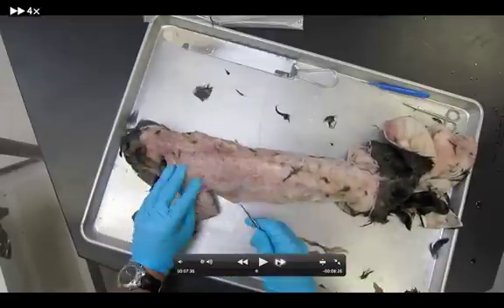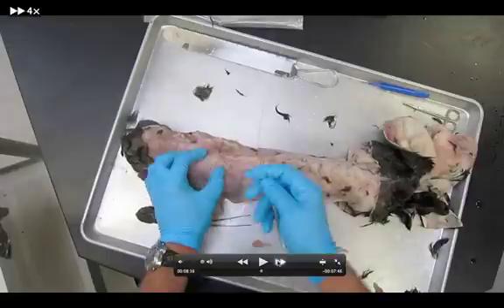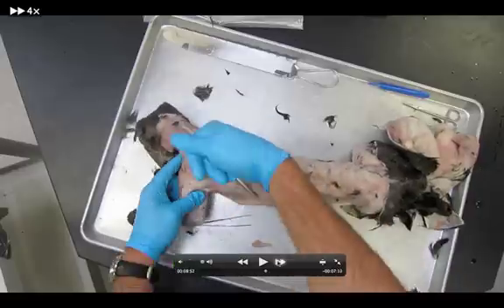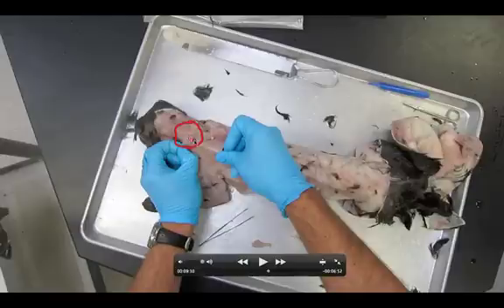Now I need to find that new line — that's kind of a difficult one. I'm locating it right there. I'm going to use my tweezers, forceps, to peel away more loose connective tissue and locate that line. Once I do, you're going to notice my probe can go underneath. I'm using my finger to free everything up. Right here is where I'm going to shove my probe through, and we're going to find three muscles all coming together: the clavotrapezius, the acromiotrapezius, and another muscle called the levator scapulae ventralis. Let's watch how this looks when we start freeing them up.